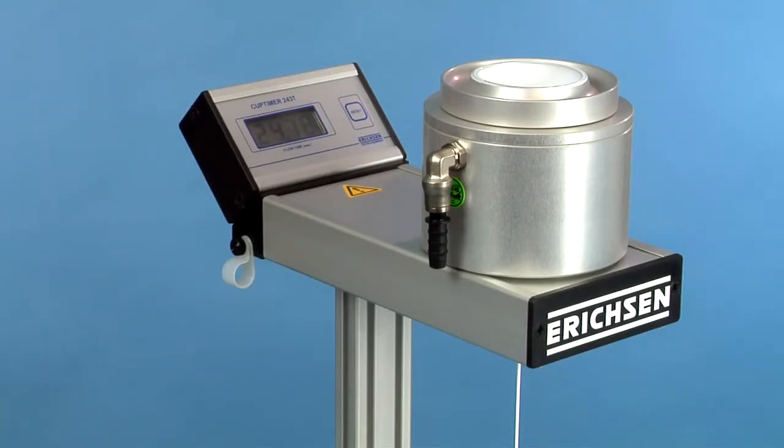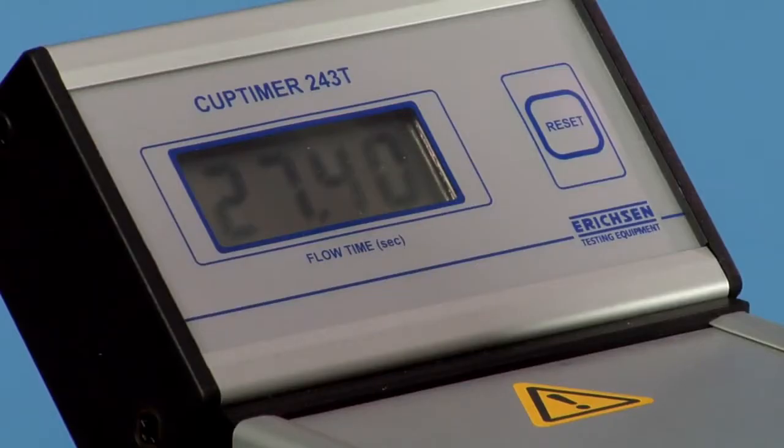The counter stops automatically as soon as the liquid coating material stream begins to drip. The value is the flow time in seconds.